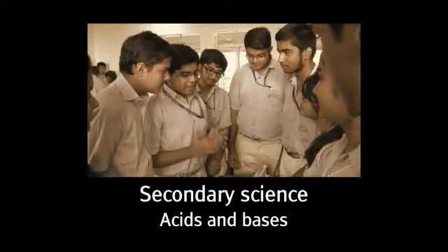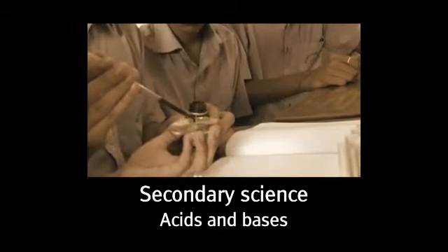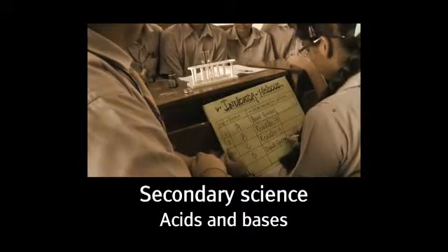In this video, students work in groups to test the acidity or alkalinity of unknown solutions with natural indicators made at home.